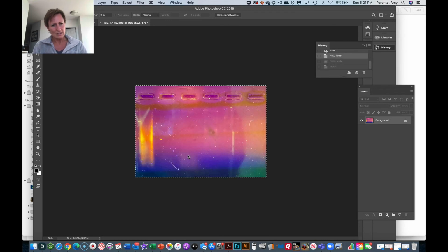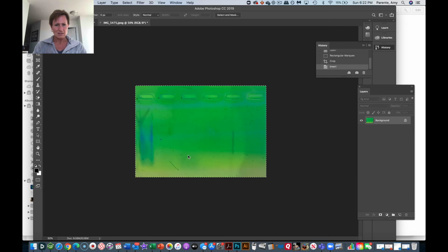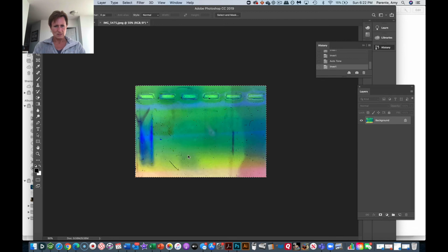Now, I don't necessarily like what that did when I did my auto level. Let me try invert. No, I don't want to invert first. Let me unsaturate. No, let's auto level. And sometimes it's the order that you do things in. I guess that worked okay there. So I was just changing the order that I did things in. That's okay because I'm doing everything to the whole gel.